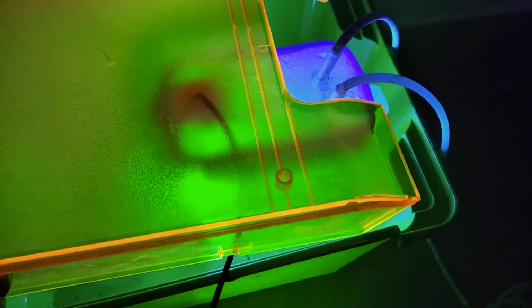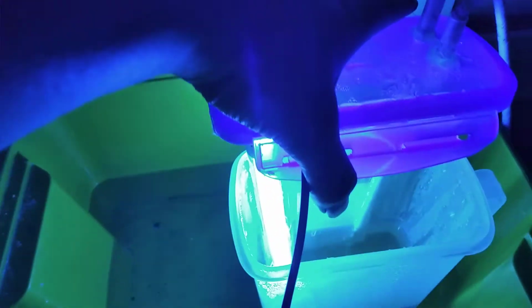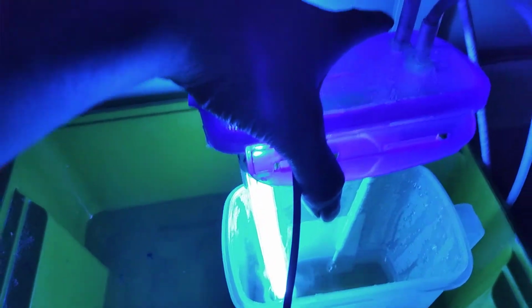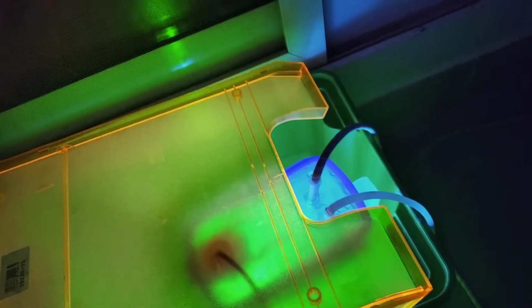I don't know if I can get this to happen again, but if I take the HCl generator and open it, it releases white smoke. Like, that's hydrogen chloride vapor coming out, which means that this thing is really concentrated. I'm holding my breath. Holy heck. That is really strong. That just feels like pain.